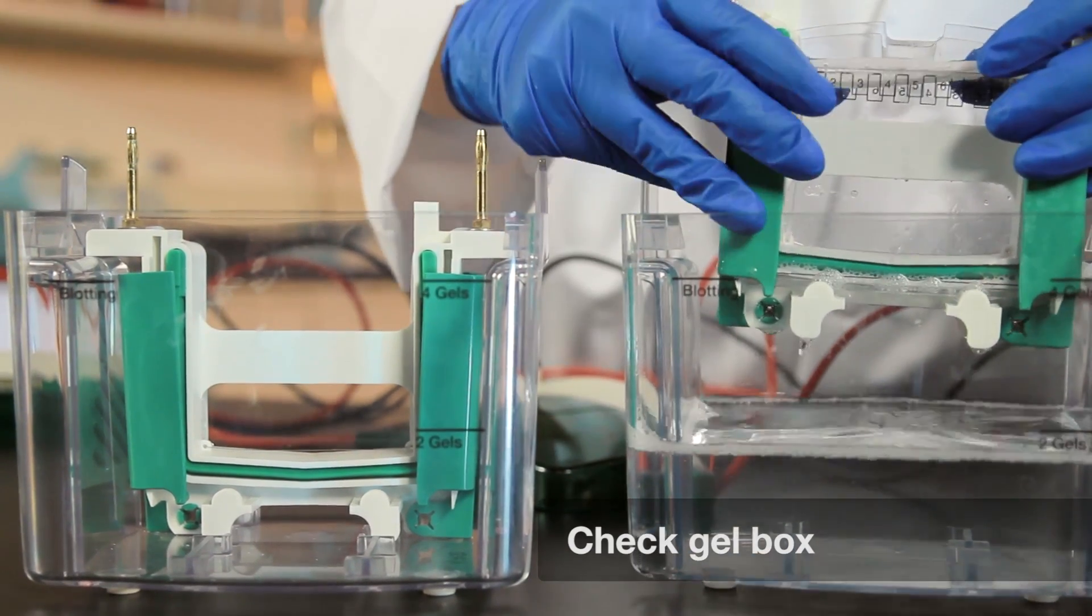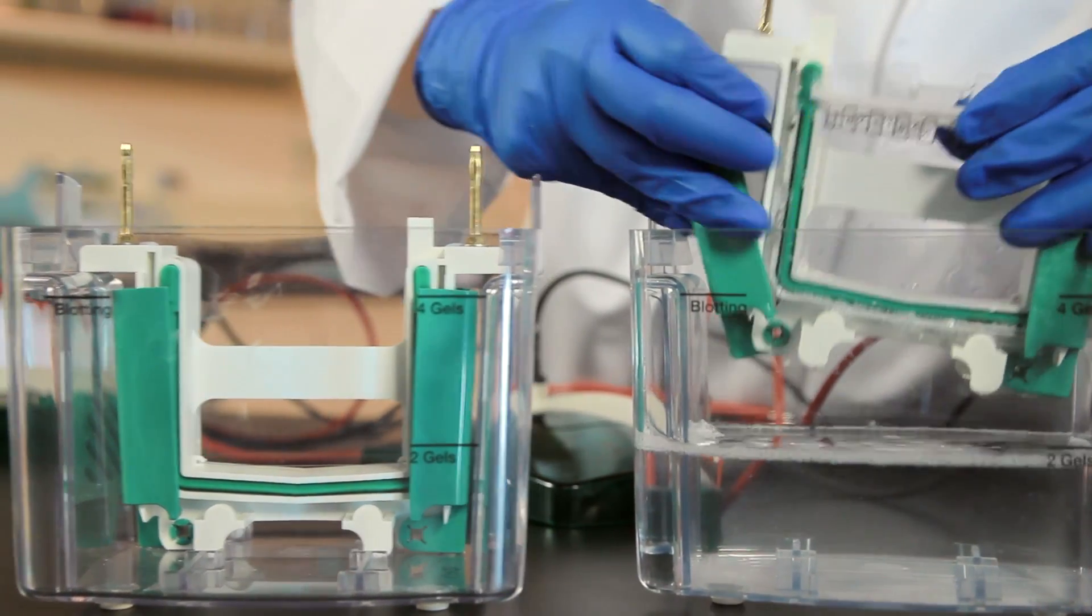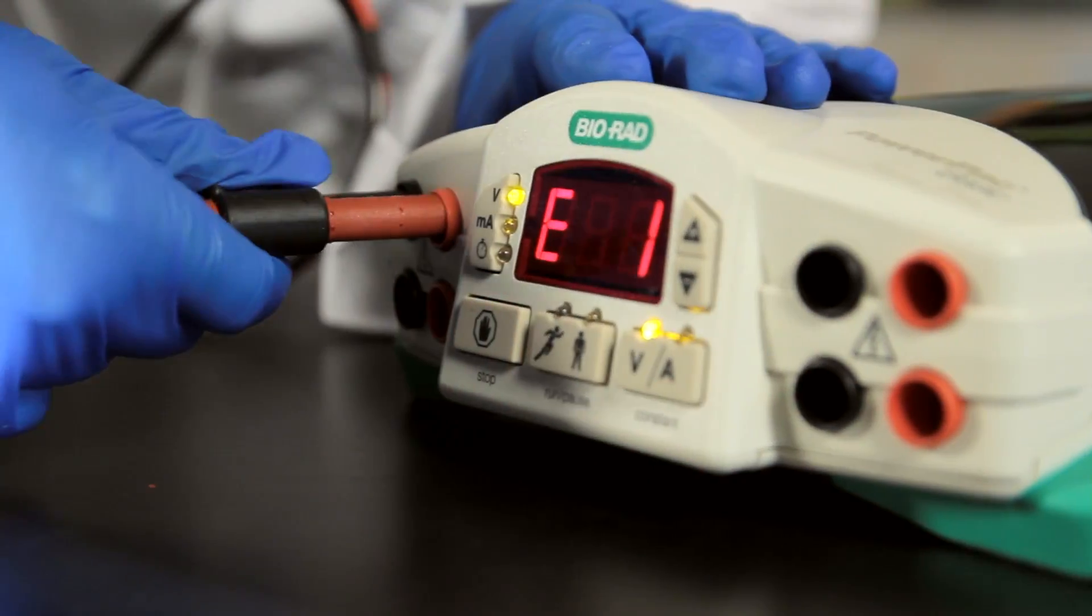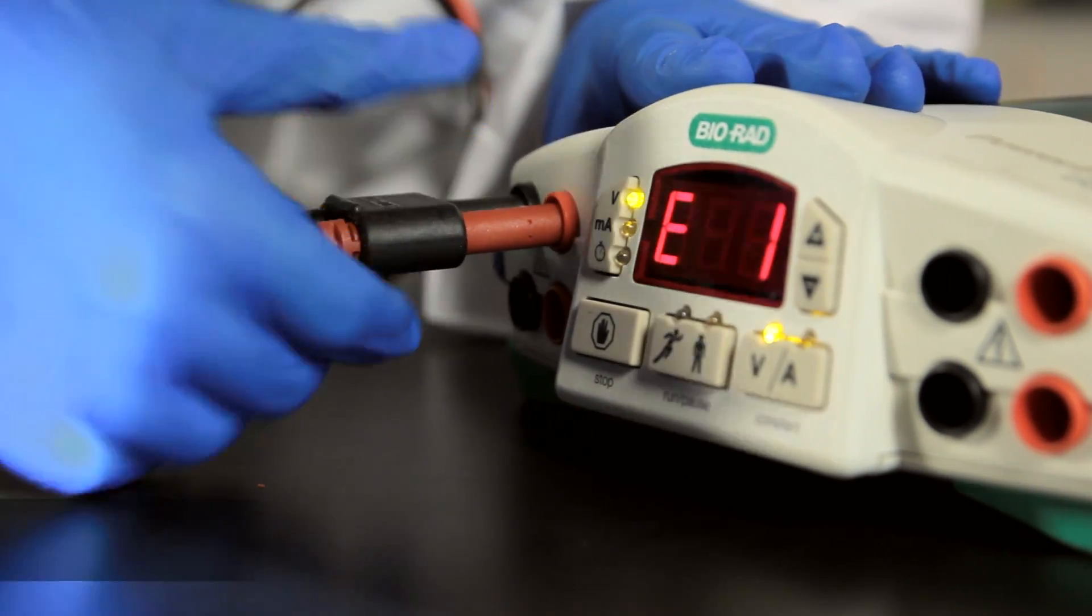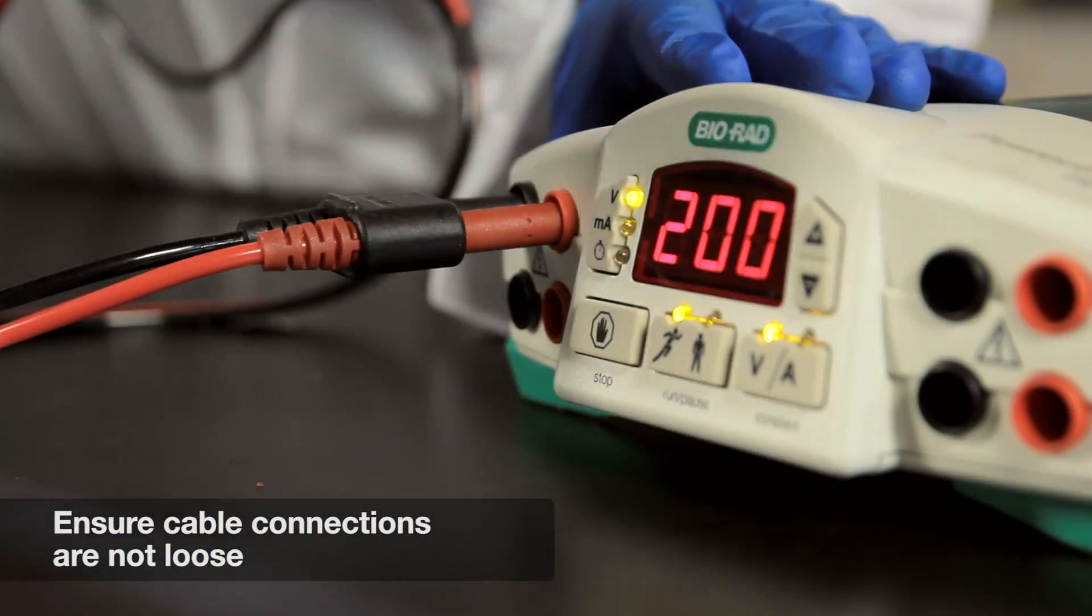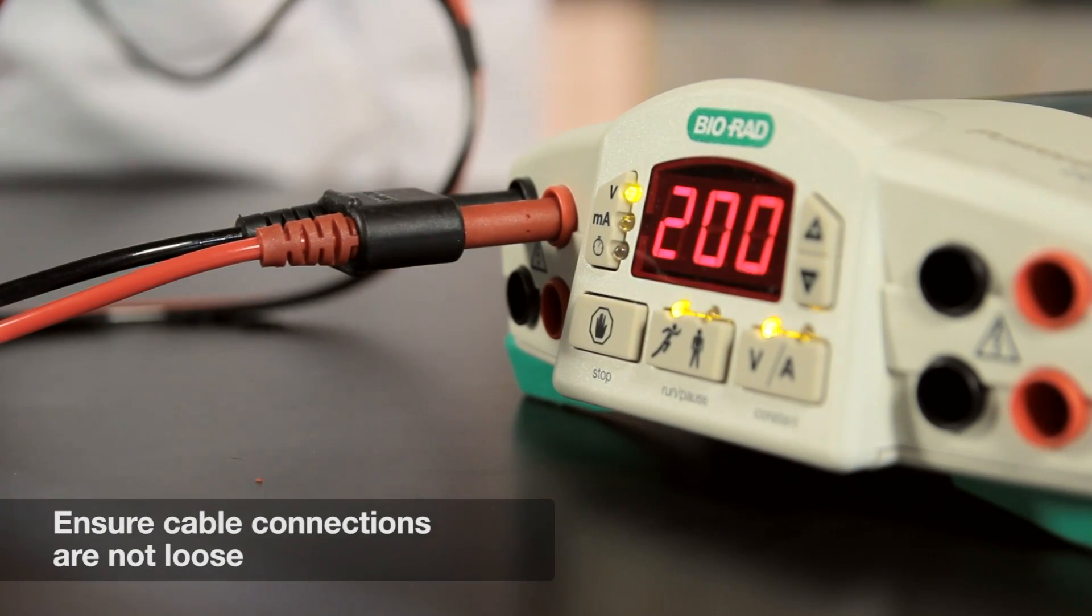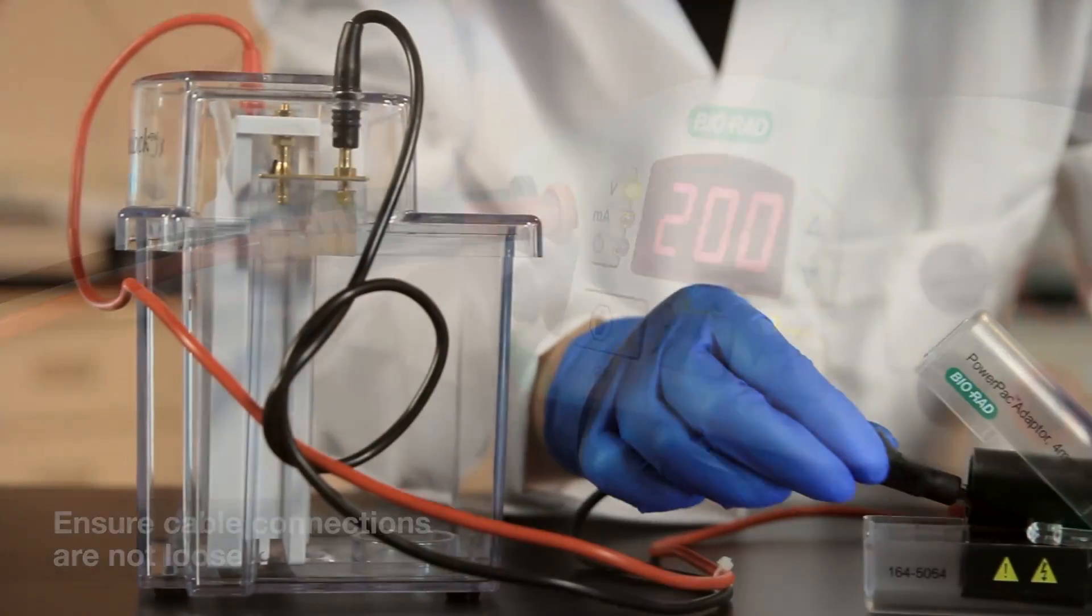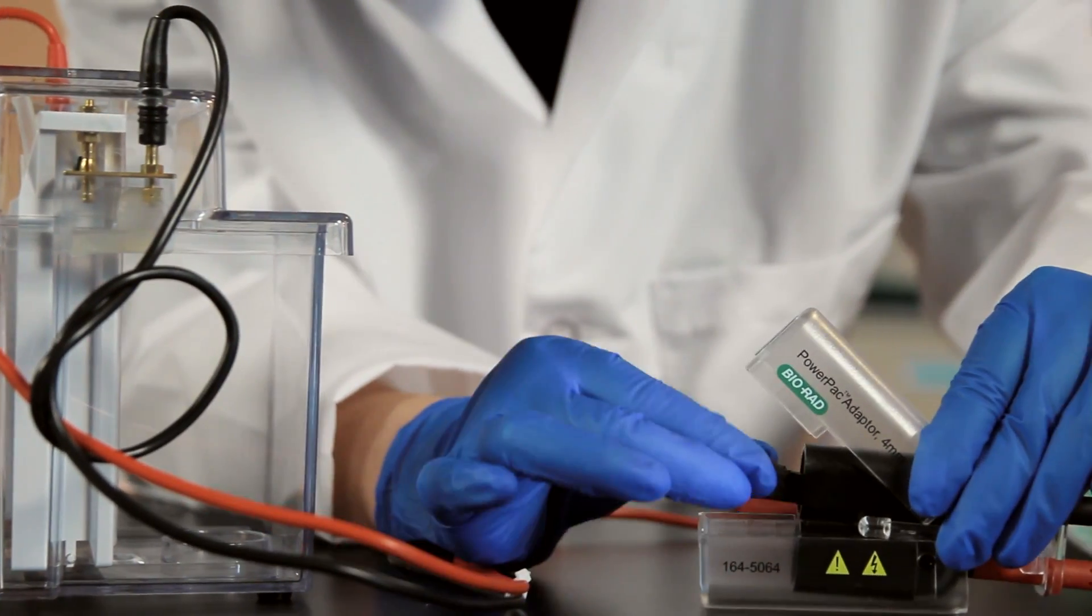The problem could be due to corroded leads, frayed wires, or broken platinum wires. The problem may also be as simple as a poor connection. Check to see if the male leads of the gel box are completely seated in the female terminals of the power pack. If you are using a non-BioRad gel box, you may need an adapter.